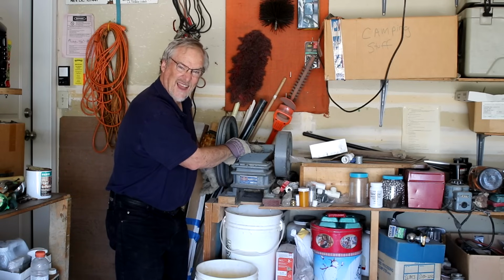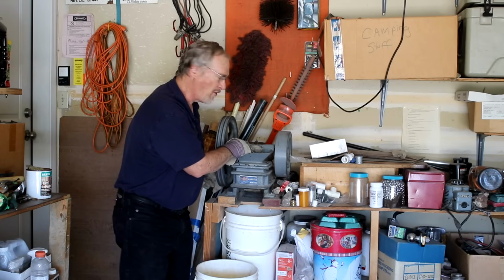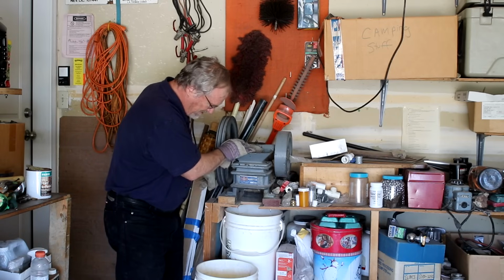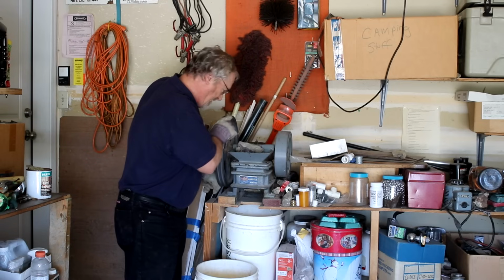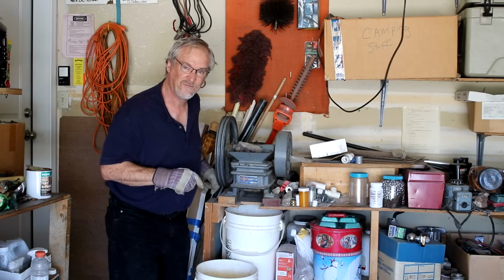It's not really an exciting process to watch, but I thought I'd give you the feel for it. You can probably see it coming out down there below. It goes into this bucket. I'll collect it up. And then the next step will be the hammer mill, and I'll show you the hammer mill right now.